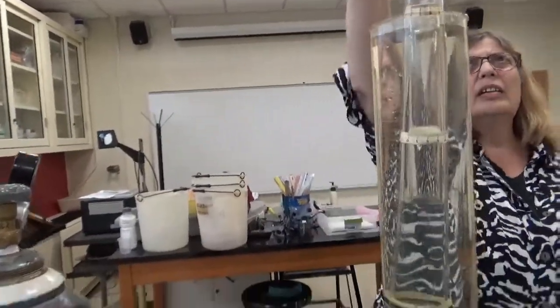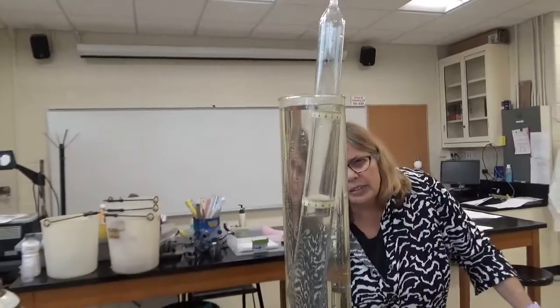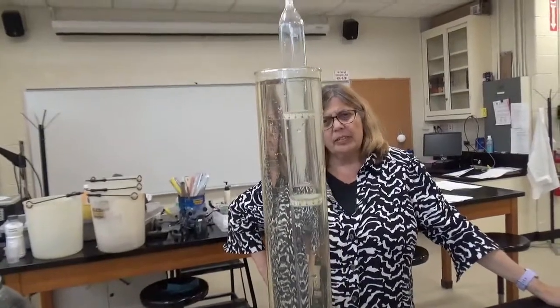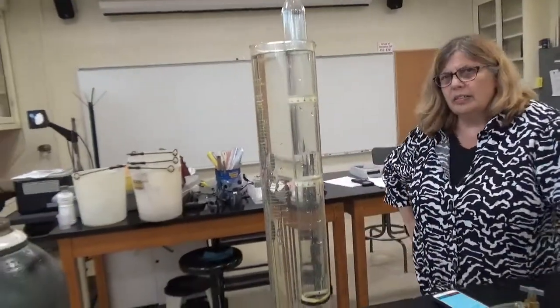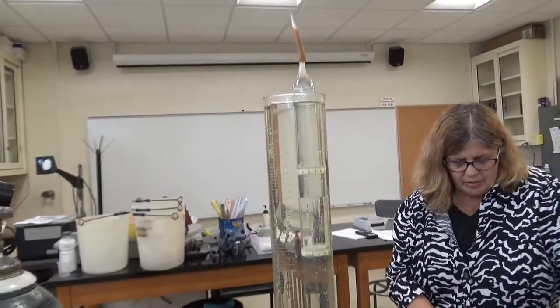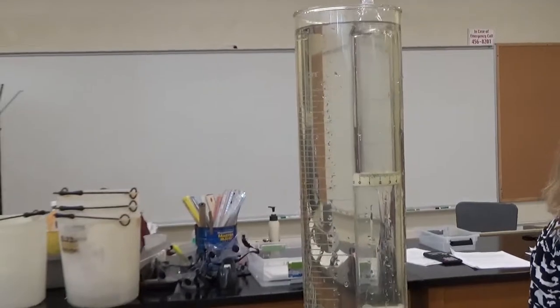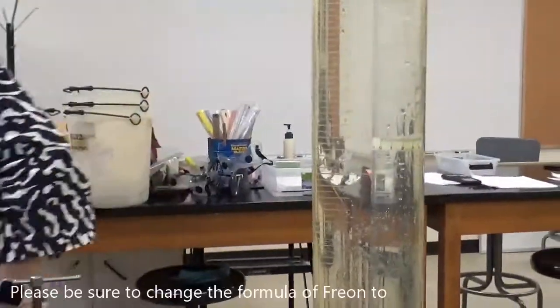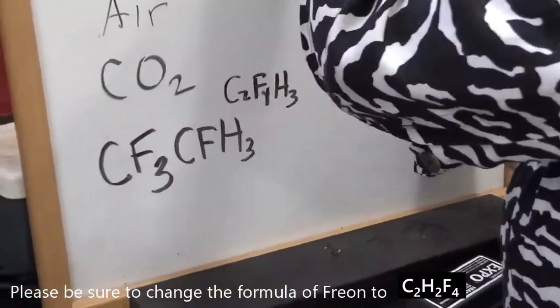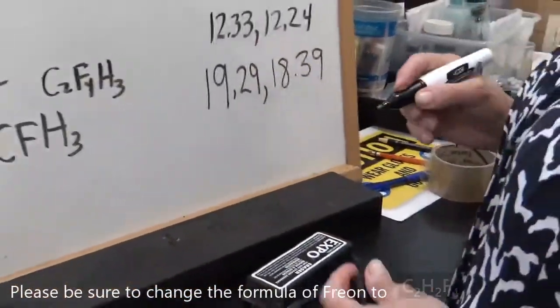So we're going to go through the same procedure. Release this tip. We're going to say start soon. Start. Stop. Okay. So mine is 18.39. Okay.